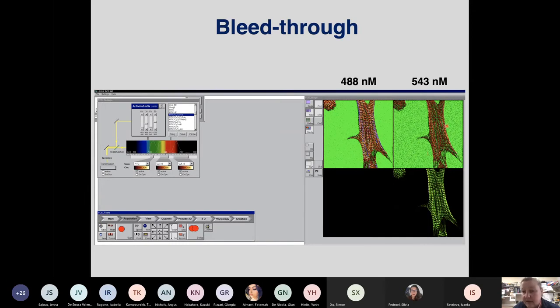In 543, when we are collecting signal, we are also seeing something, which we shouldn't, because when I go over here and look whether the laser line is actually active, it's 0. So there shouldn't be any signal coming through here. So the signal that I'm seeing here is the bleed through that comes from the green channel into the red channel. And this is a real problem with confocal microscopes if you have a very, very intense green signal.